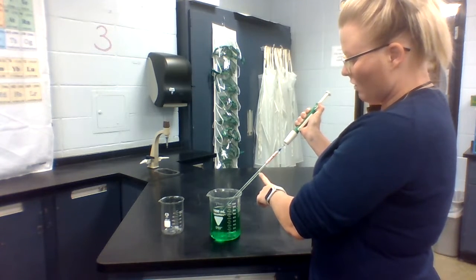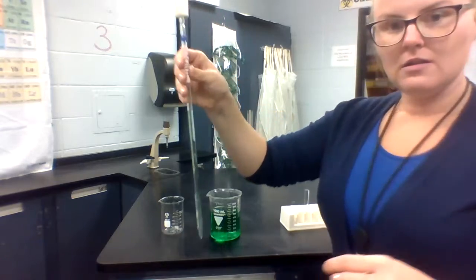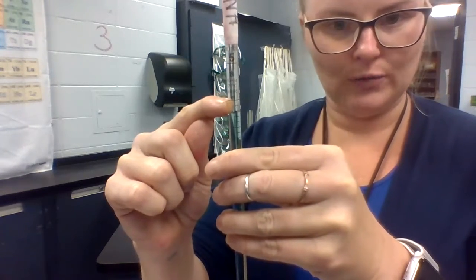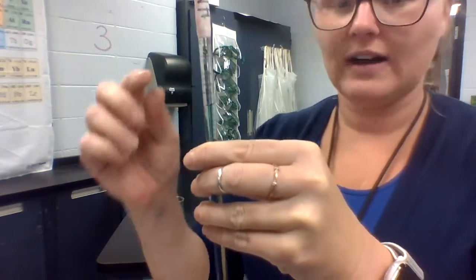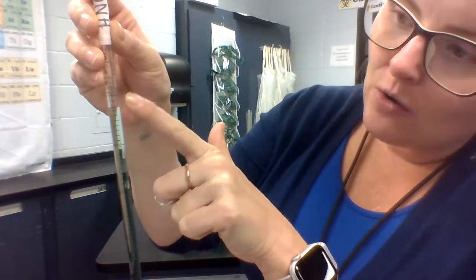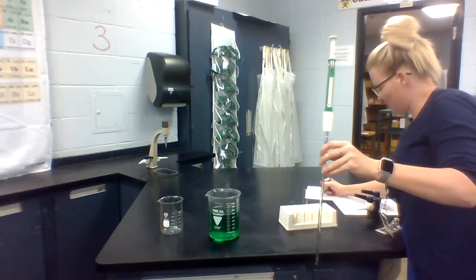You're not going to go all the way to the zero mark — you're going to be a little bit shy of that. You can see here my fluid level, and the zero line is actually right here. I'm going to go ahead and read this now and record this value. Since I'm in units of one, each of these marks on the scale is a tenth. So right now, if I'm at zero, this would be 0.1, this would be 0.2. I'm a little bit between 0.2 and 0.3 but closer to 0.2, so I'm going to record my initial value as 0.23.